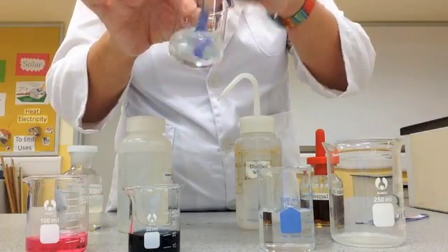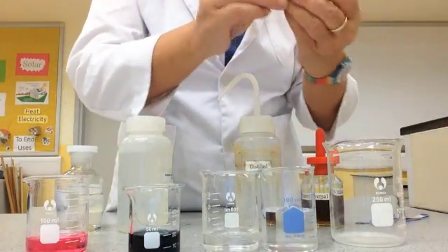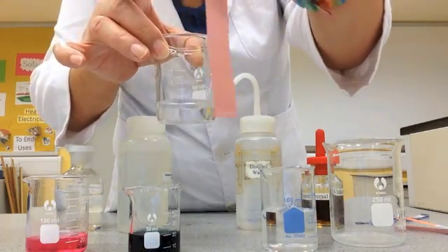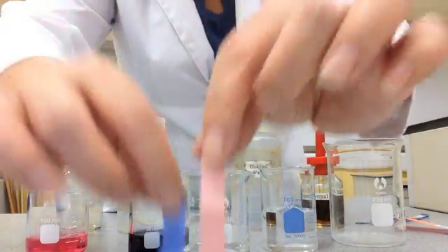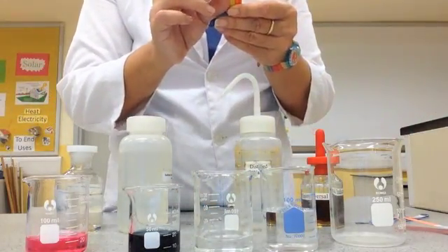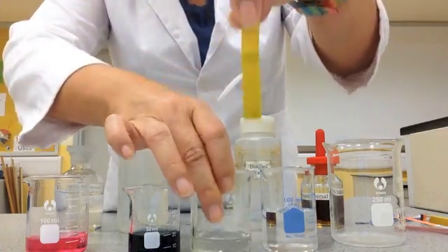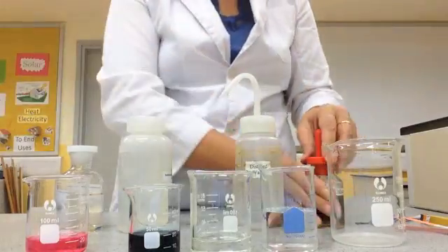Now let's test this next substance. The blue indicator paper remains the same. Of course, you cannot assume it's neutral until you test it with the red litmus paper. The red litmus paper also stayed the same. When both the red and blue litmus papers remain unchanged, we can assume it's neutral. Let's try with the yellow indicator paper.